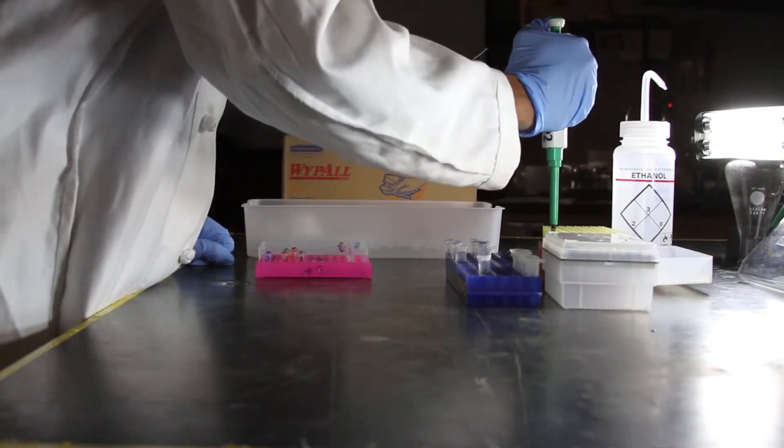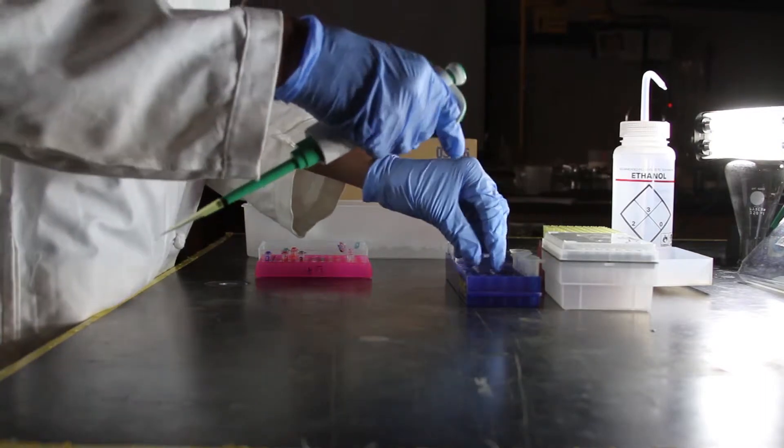Next, we will pipette 5 microliters of buffer NEB to each tube.